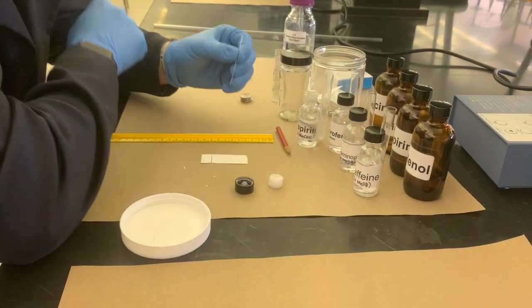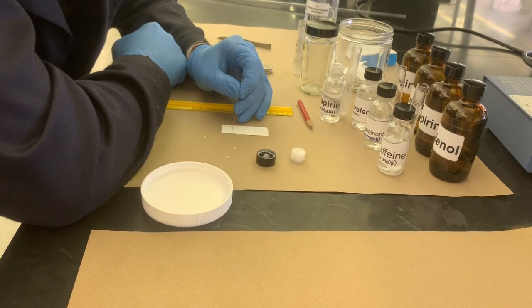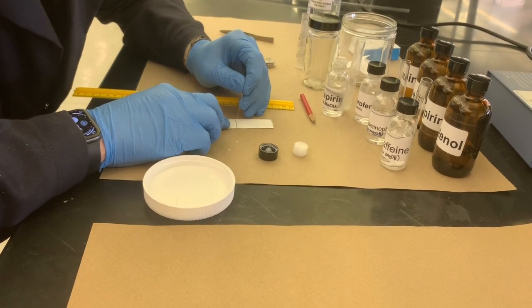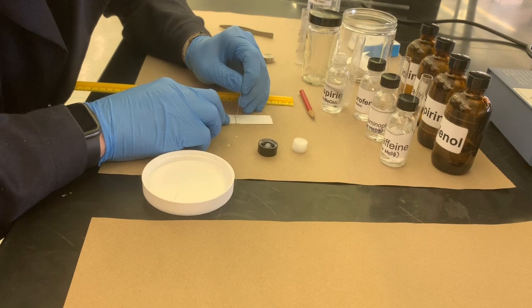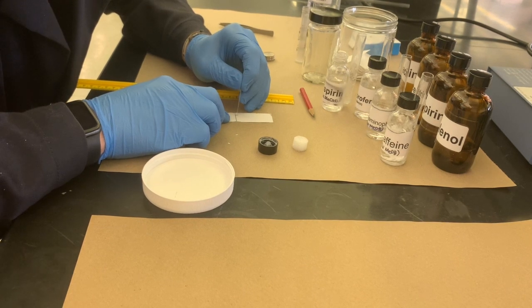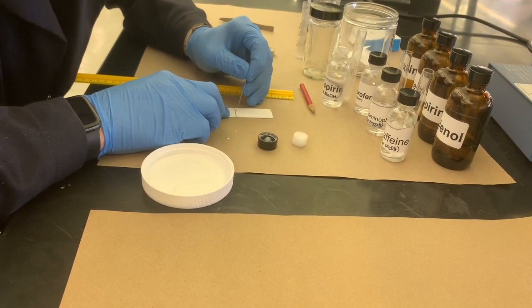So with a solution as dilute as possible, you blot in one spot and only one spot on your TLC plate. We're going to consider aspirin to be number 1 on this first plate. You can also label it at the top if you want. Try to make sure that you keep that spot in as small a point as possible because you don't want it to spread itself out during the run.